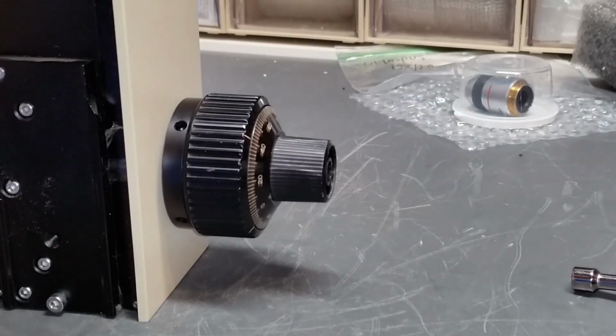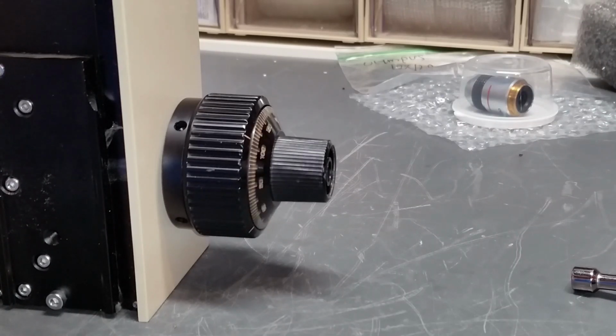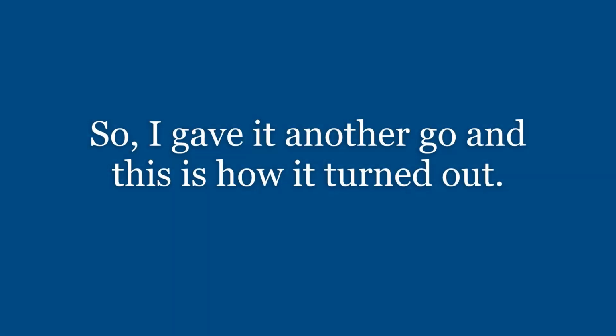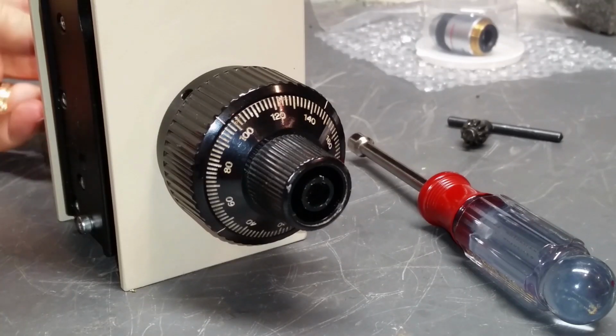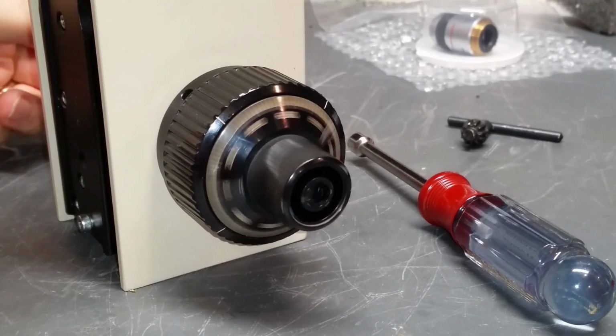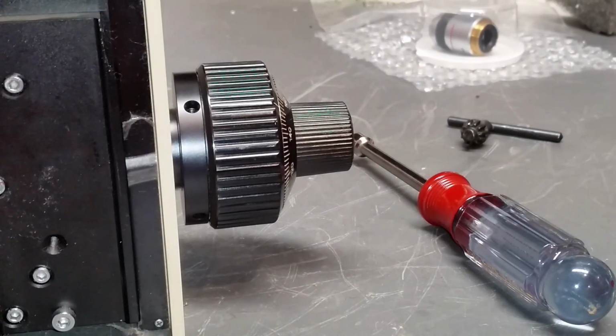And I'm going to call that a victory and say that that fine focus shaft, which was bent, is now decent again. And I think that'll be fine. I don't think anybody will have a problem with that. And here's another view. As you can see, that's pretty darn straight. I don't really have any problem with that. If we turn it from the side, you can see that runs pretty true.